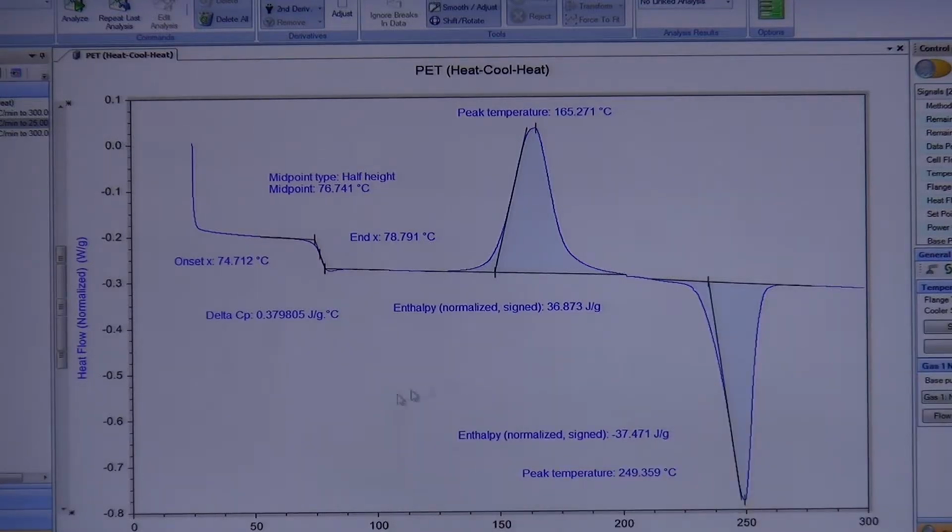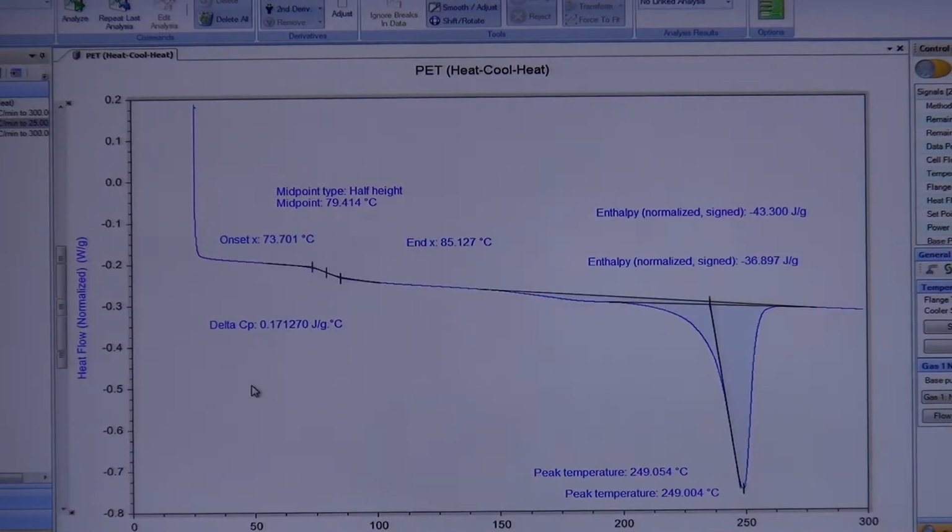that can trap it in different configurations that it doesn't necessarily want to be in, right? So now when you go past your first heat, you erase all of that, you get your original material in its more comfortable or more relaxed state, and then you can analyze what might be happening to your material in a more natural form. So, for example, this sample is polymer.